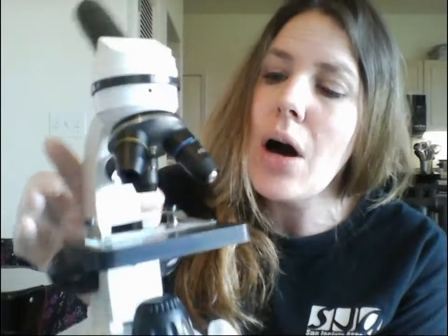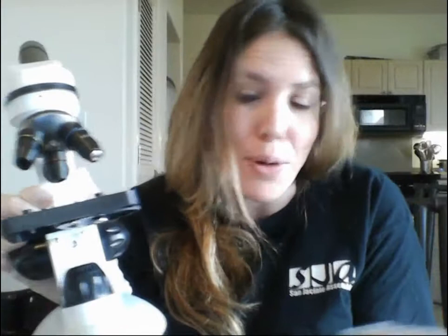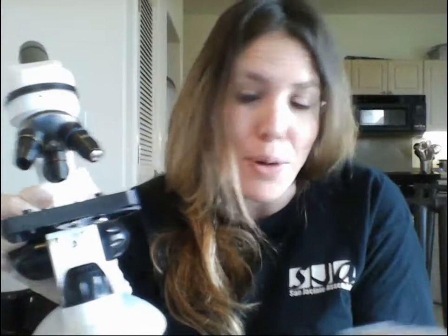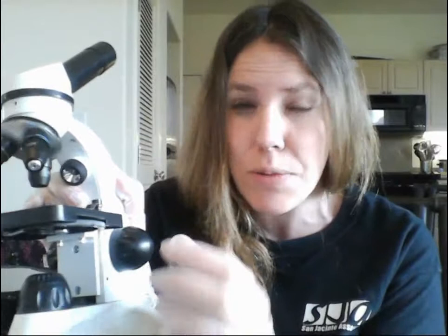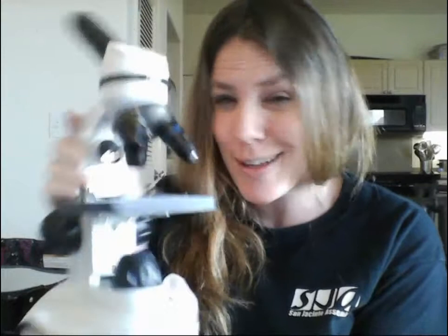On a face-to-face lab compound scope, the iris diaphragm is usually underneath with a lever to limit light going through. Ours has it as a little disc — same purpose. The other thing our scope doesn't have, which most face-to-face labs have, is a condenser — a knob and apparatus over the light that helps with contrast of the specimen against the background. We don't have that, but we really don't need it to get excellent images.